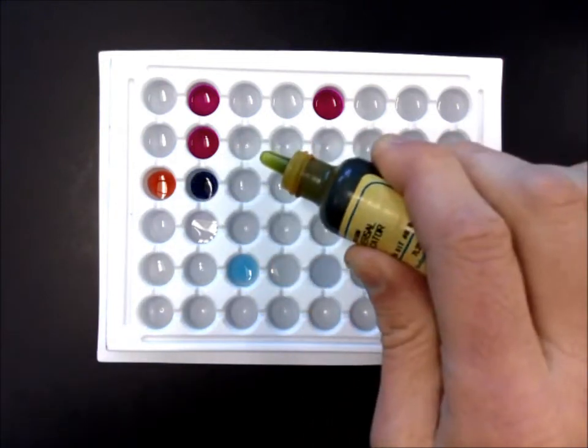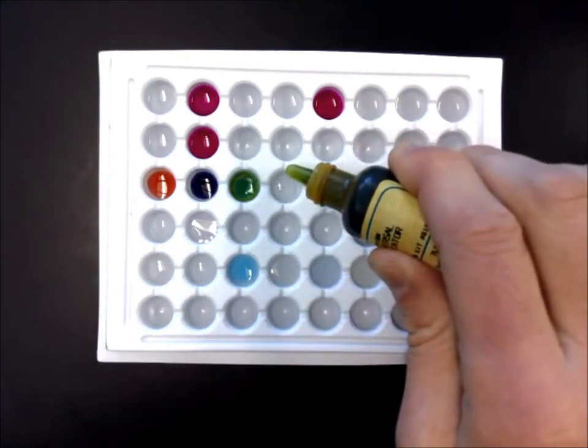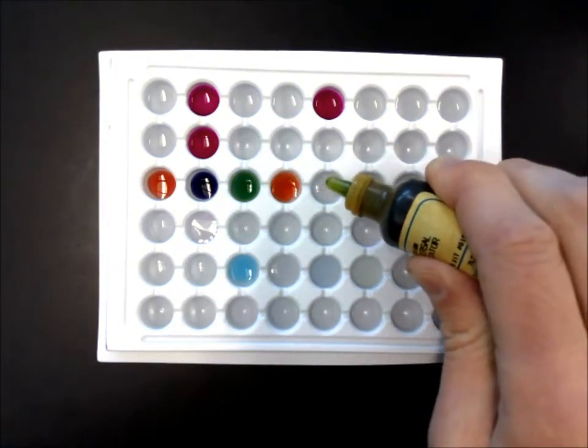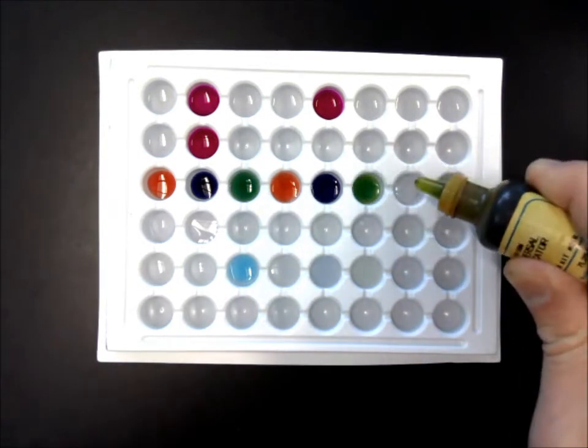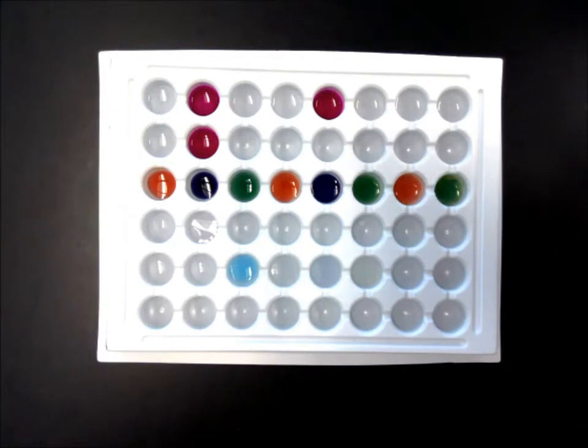And let's work our way across. So that one went definitely a blue-purple. Oh, green. And this one is actually kind of prettier because you get varying colors. There's a purple, a green, like a reddish, suggesting it's an acid.